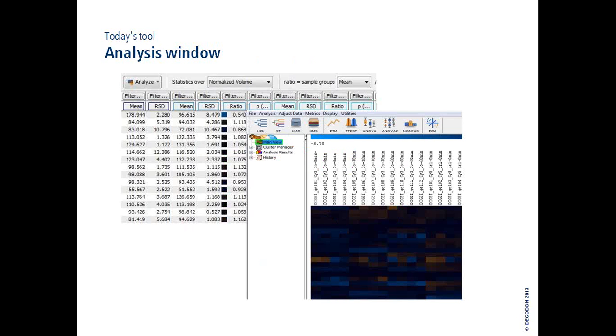The tool that we are focusing on in Delta 2D is the analysis window, which contains a number of statistical methods. Some of them will be mentioned in this webinar, and you can access this by pressing the Analyze button in any kind of statistics table. As you might know, Delta 2D comes with a statistics table, and since Delta 2D 4.2 or 4.3 you can open a number of different statistics tables according to your needs, including the groups that you like to be included. And for each of these tables, this Analyze button is available, while there's only one possible analysis window open. It will be reopened with the new data if you click it from another table. So this is the analysis window, and let's go ahead.